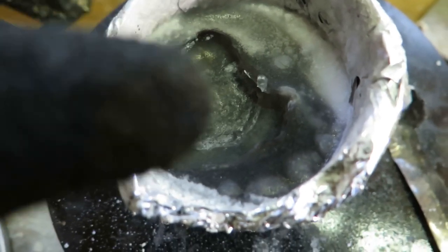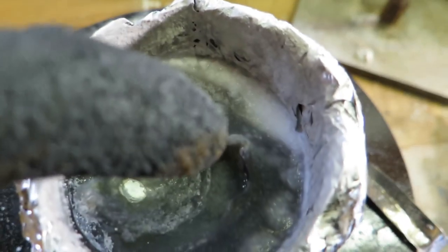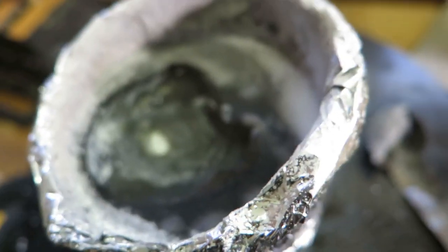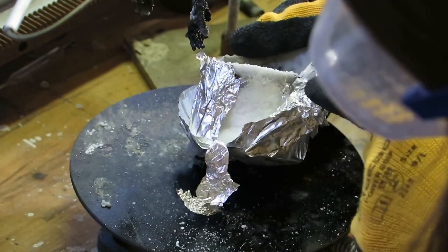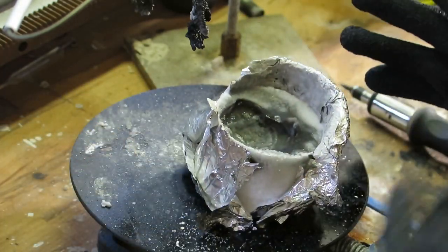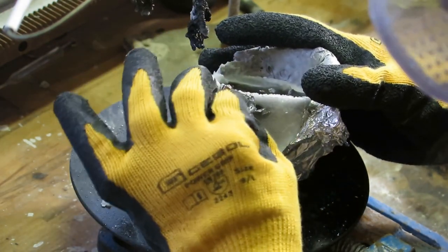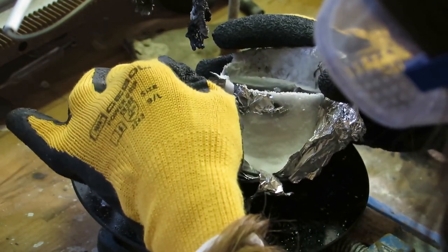But the hydroxide is clearly dark, and it seems that, like here, you can see that it's still white and it was never molten probably. So if I unpack this foil, you would probably see that it wasn't really damaged even, and the black is from the electrodes. Unmolten, yeah, at the bottom it's unmolten, and you can see that it is white where the aluminium is. So it's really from electrodes, like 99.9%, even though, yeah, must be.